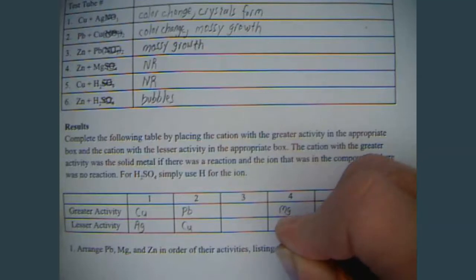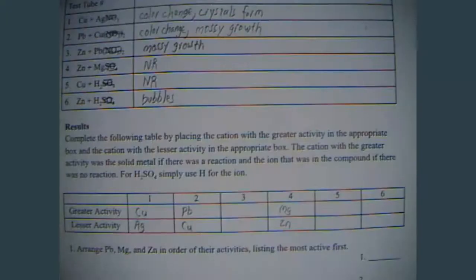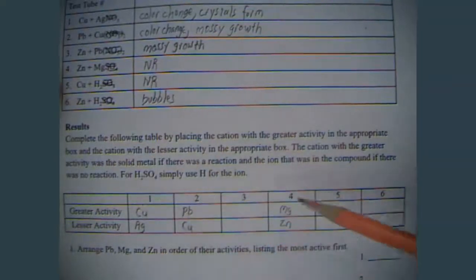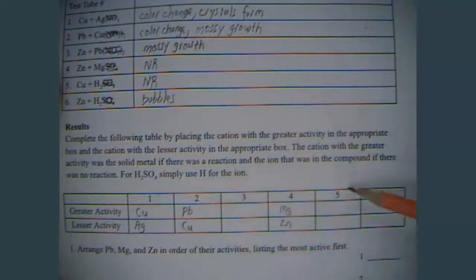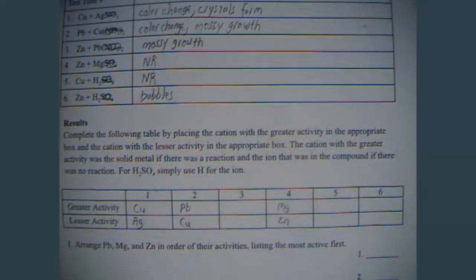And now that I've kind of shown you some of these, I can't give them all away to you. Because, again, it is a lab. So, I did 1, 2, and 4. You're going to have to figure out what 3, 5, and 6 are.